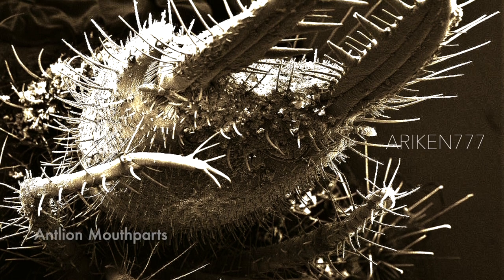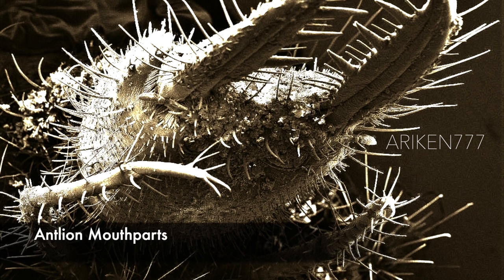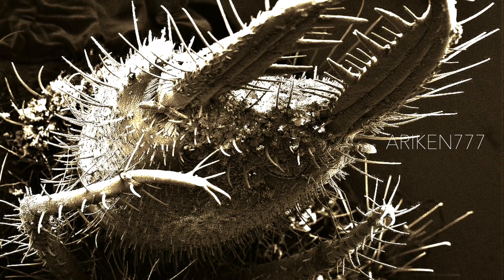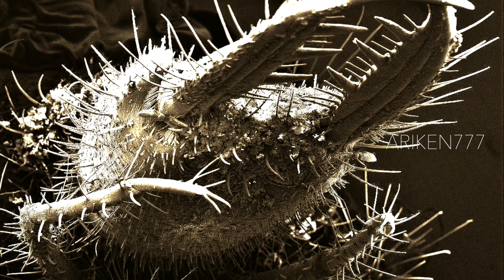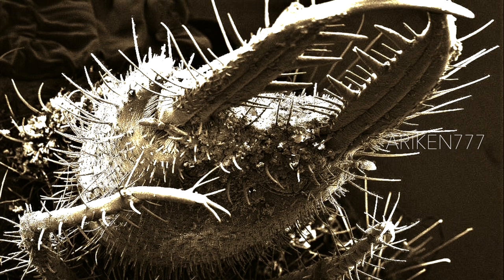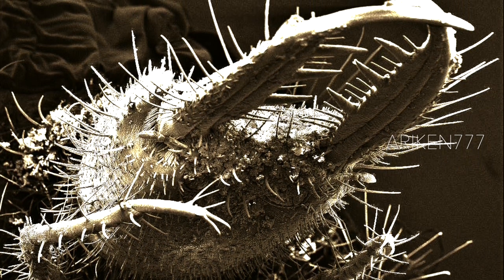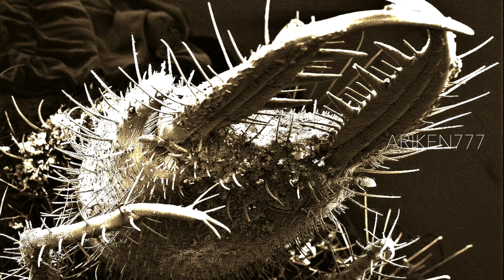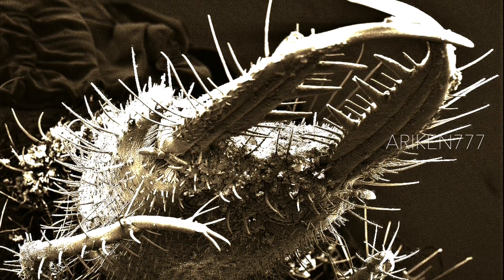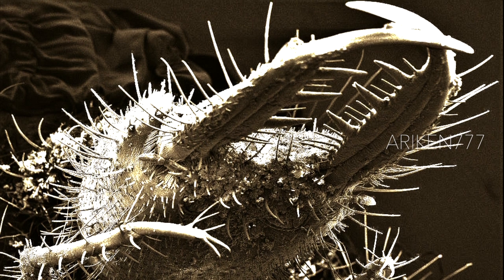Mouth parts of an ant-lion. The larval form of this insect lives at the bottom of a cone-shaped hole where it waits patiently for any unsuspecting prey. When ants or similar insects fall into the hole, the powerful jaws of the ant-lion crush and kill the prey. Another name for the ant-lion is the doodlebug.